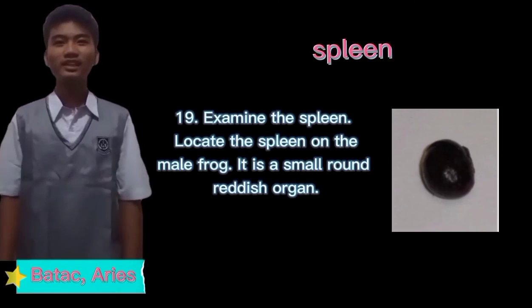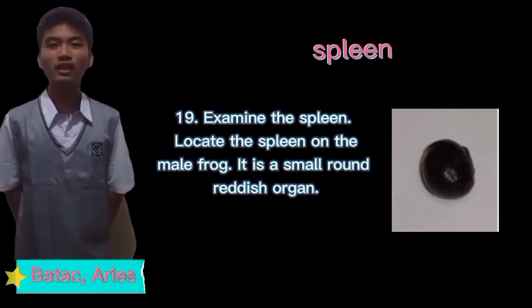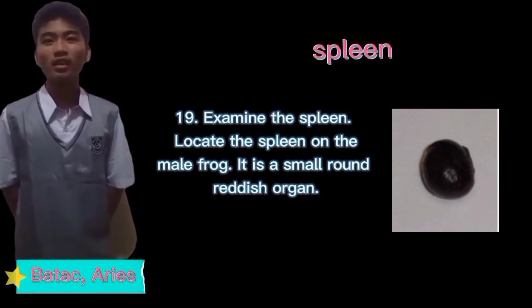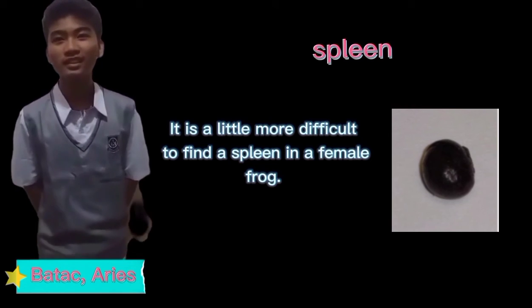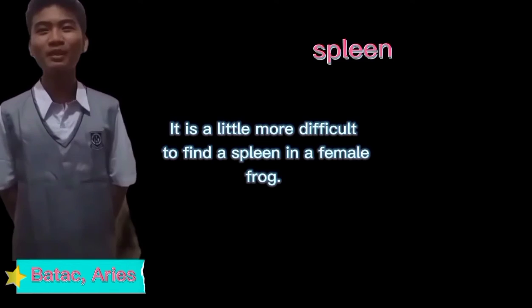Spleen. Examine the spleen. Locate the spleen in the male frog. It is a small, round, reddish organ. It is a little more difficult to find the spleen in a female frog.